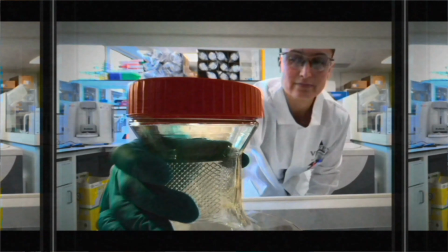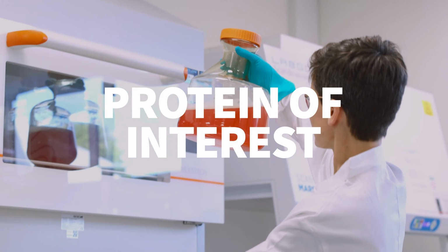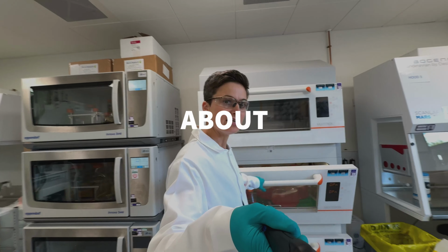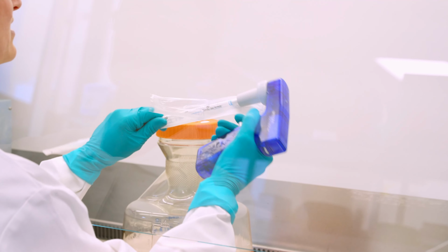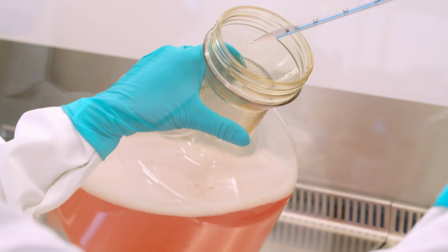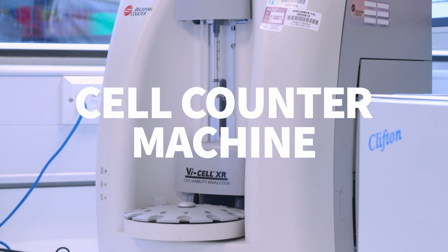Yeah, thanks, Rachel. So we've designed the DNA construct, and in this lab, we add the DNA to the cells and use the cell's protein production machinery to make our protein of interest. So I've prepared about 12 liters of cells. So I need to just take a small 1/2 ml sample of my 3 liters of cells, and that will go onto the cell counter machine.